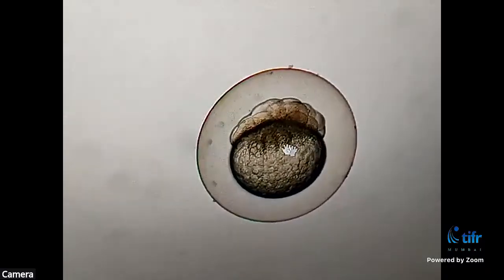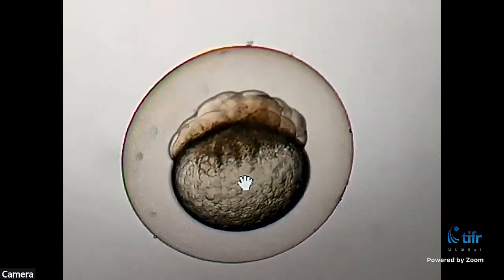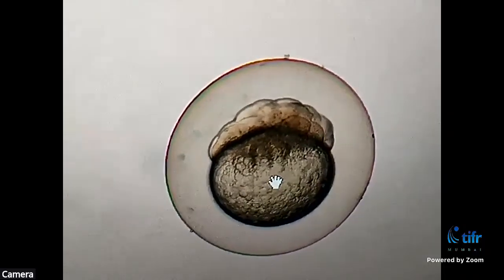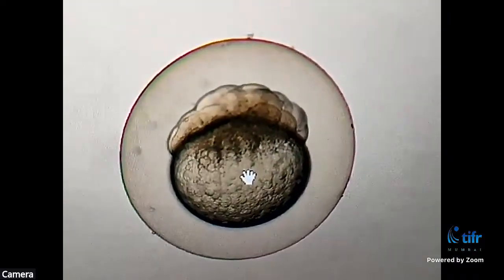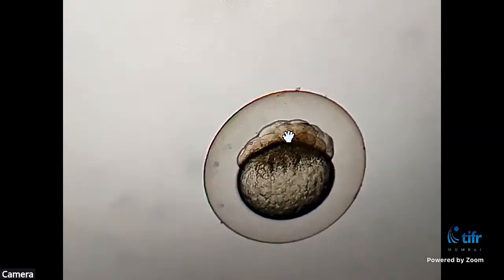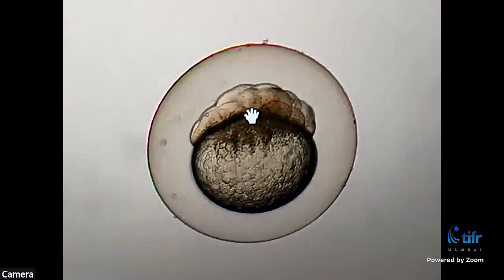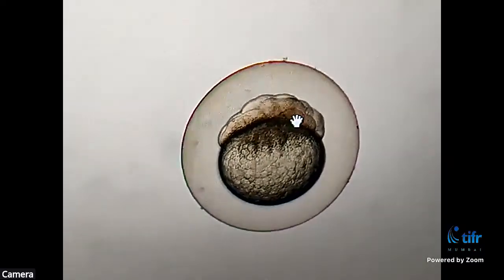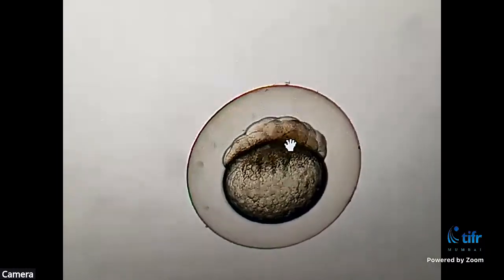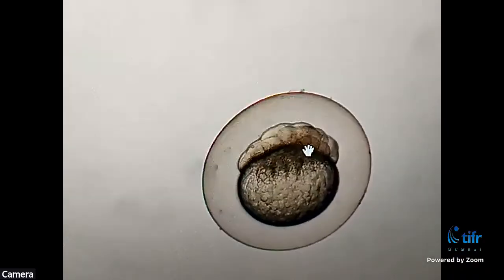And then this big ball-like thing which you are seeing is called the yolk. Many of you might know what a yolk is. The yolk contains nutrients and other substances which help in the development of the embryo. So now where is the embryo developing? This structure which you are seeing on the top, like a mound, is the cells which started from one cell, and then have divided many times, and you see a mound of cells. So this is the actual embryo which divides and ultimately leads to the formation of complex structures.